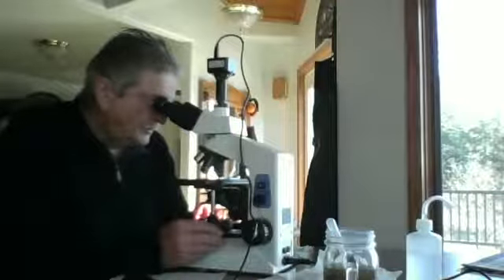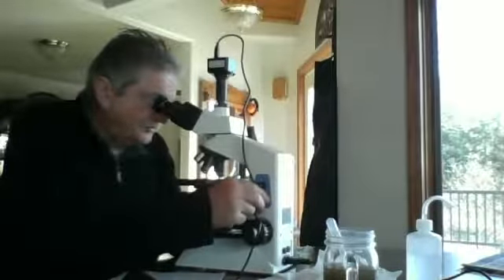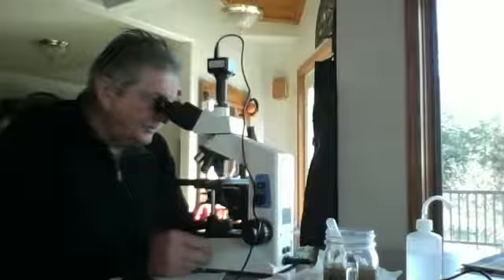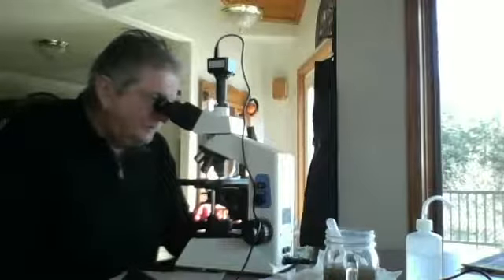And sliding around the field of view. Turn it up to maximum brightness. Looks like it's just about right. It's interesting, these bacilli are long. They look like they're about 10 micrometer long, and they've got a black dot at each end.